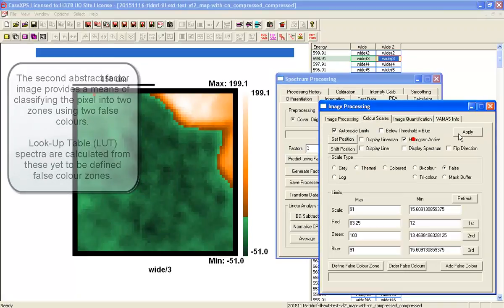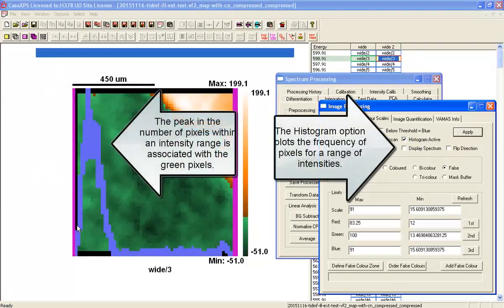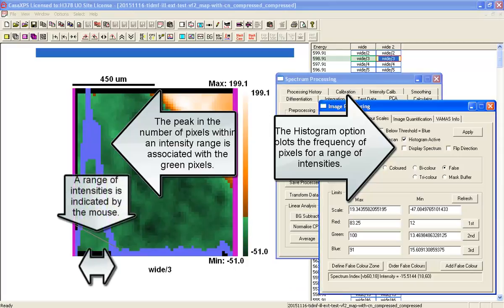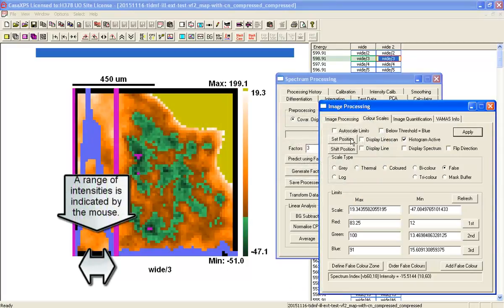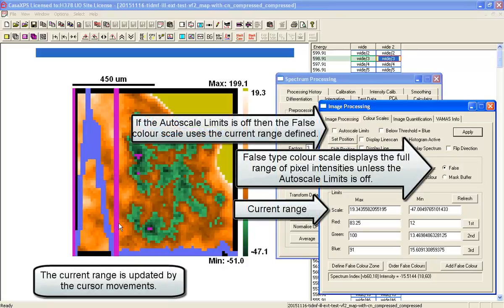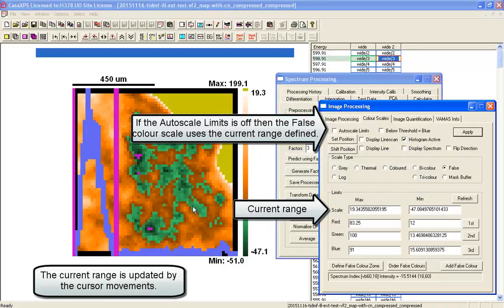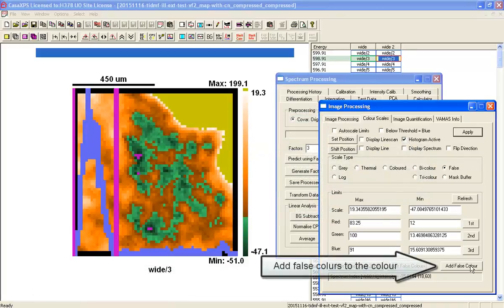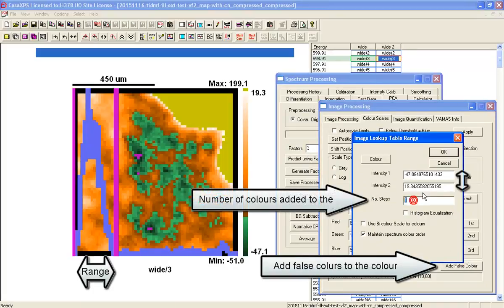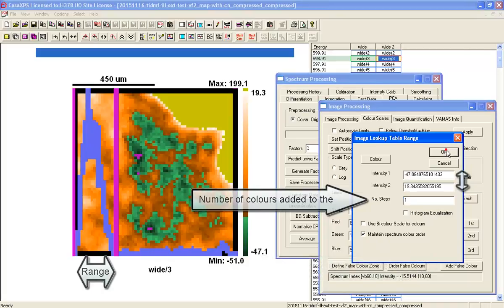So let's put on a histogram. So I'm going to mark up a position there. I'll turn off the automatic limit calculation so that it's using the range that I specified with the cursor, using this color scale, the pixels that would be identified by these two limits. And what I'm going to do is mark those up as a color, and I'm going to use one color to mark all of these pixels.